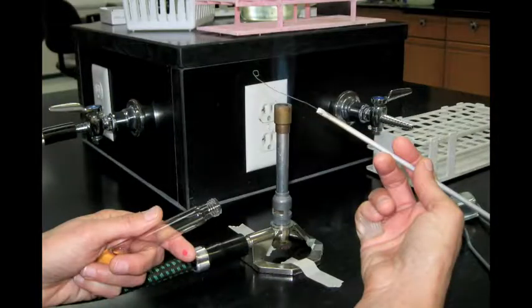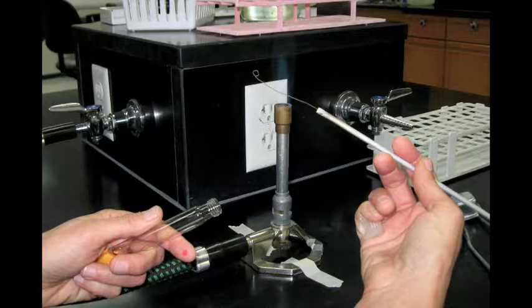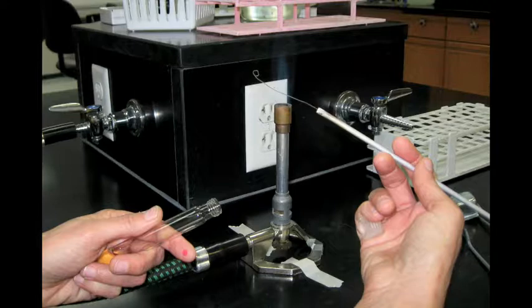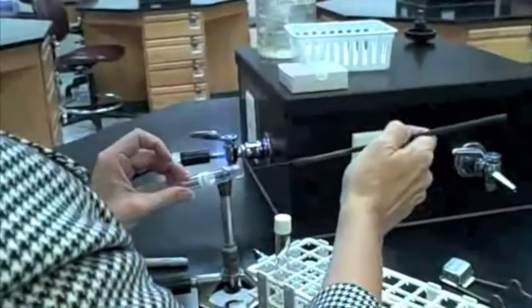Okay, so you should be holding the loop and the cover to your tube in your dominant hand, while holding the stock culture tube at a slant in your non-dominant hand. Hold the loop perfectly still, and slide the tube up the loop to get your bacterial specimen. The trick here is not to let the loop touch the sides of the tube.